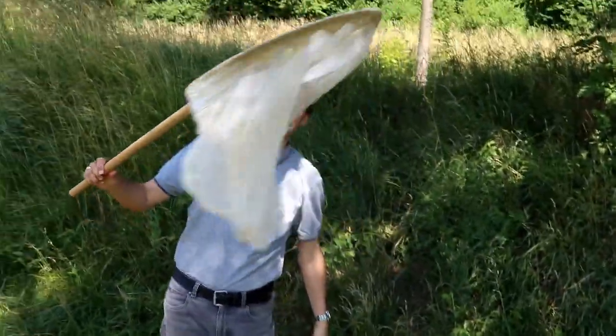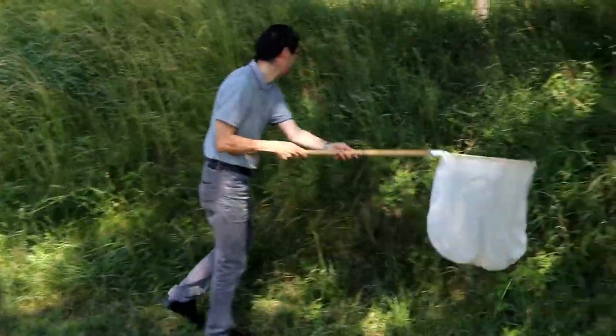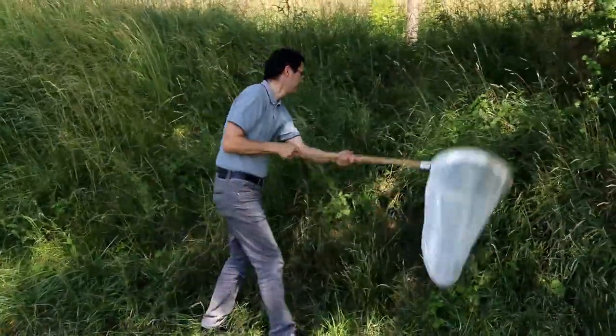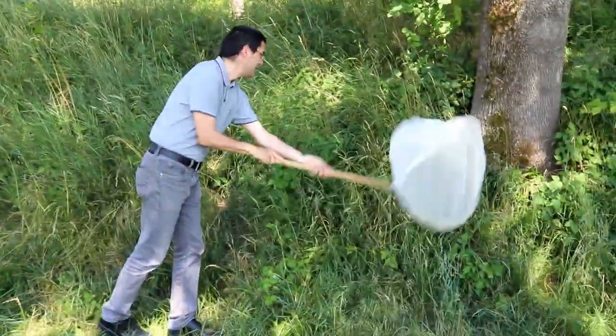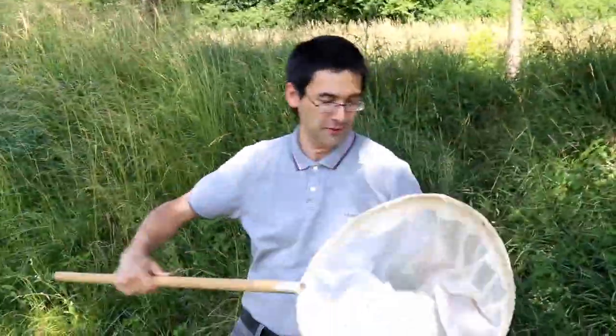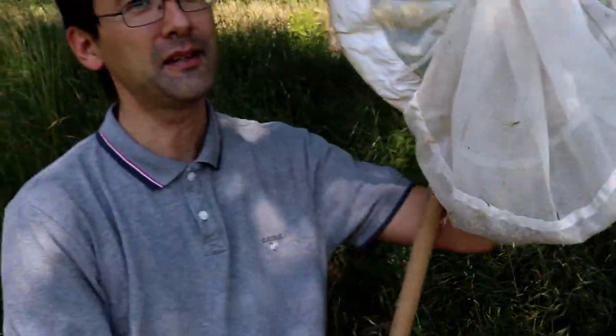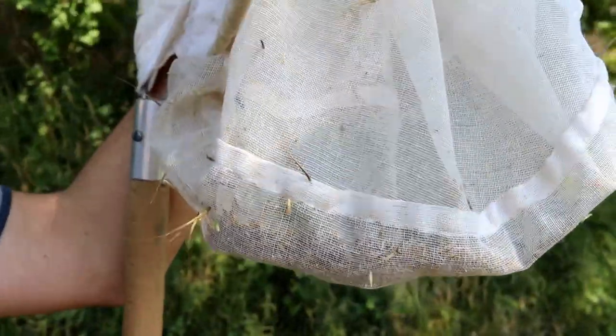What you need is this insect net, and then all you do is sweep the vegetation using this net, hoping to catch as many insects as possible. You shake them down and then you add some substance to anesthetize and kill the insects. Then we're going to use a stereomicroscope to identify them.